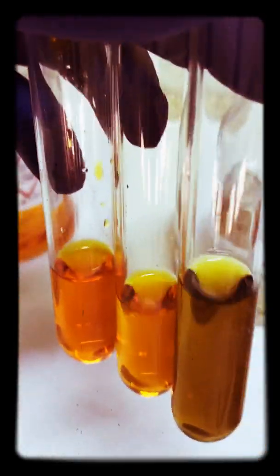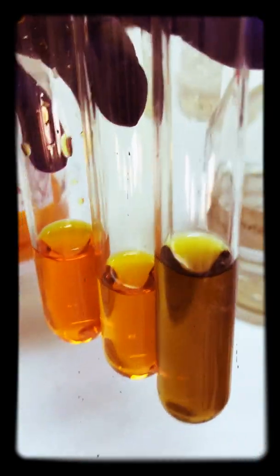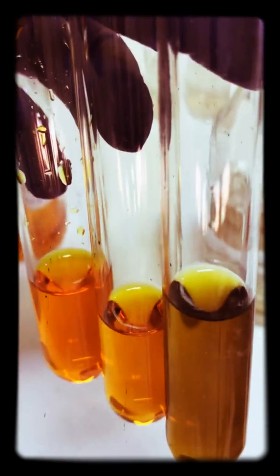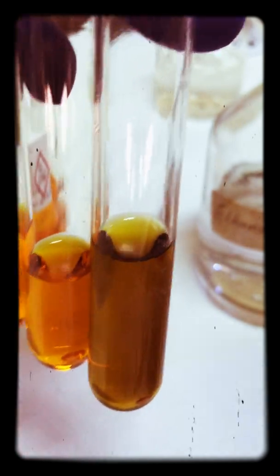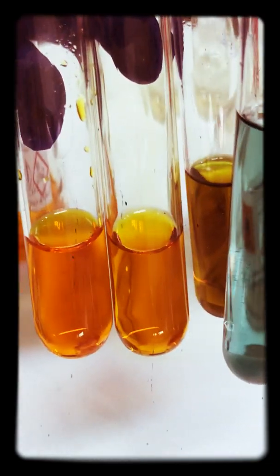You see it's going green, and the reason why it's going green is because of a chemical reaction that is forming the Cr3+ ion, which has an oxidation state of plus three. After a day, it becomes that color there. So you can definitely see a transition of colors along the way.